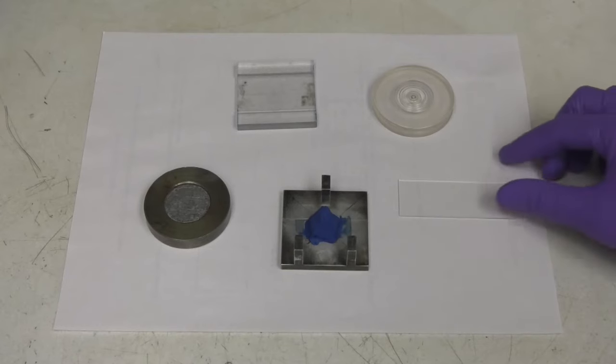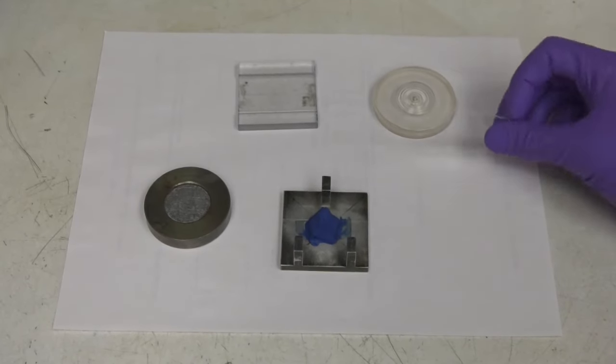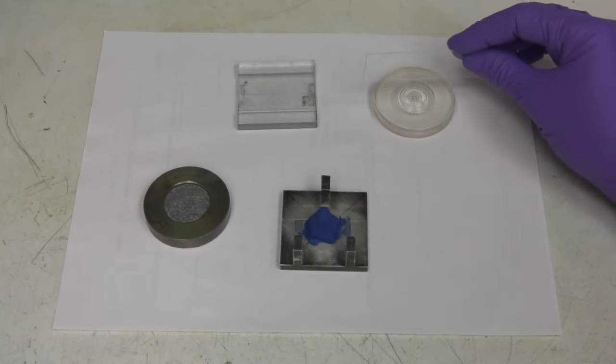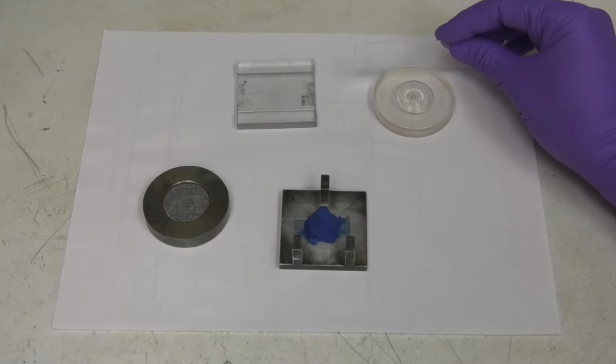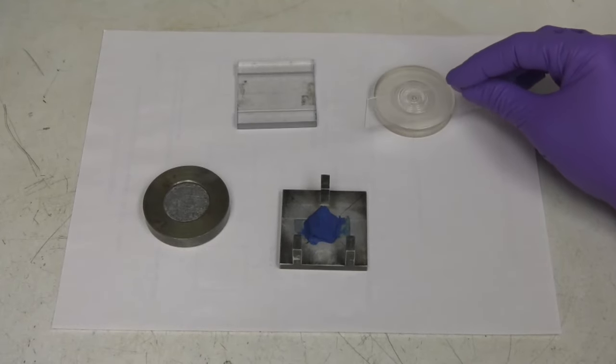There are various types of sample holders for different samples. No matter what type of holder is used, it is important that the surface of the sample is flush with the top surface of the sample holder.